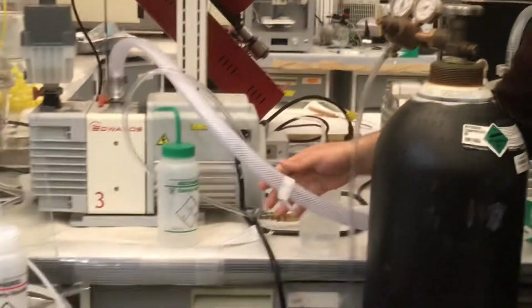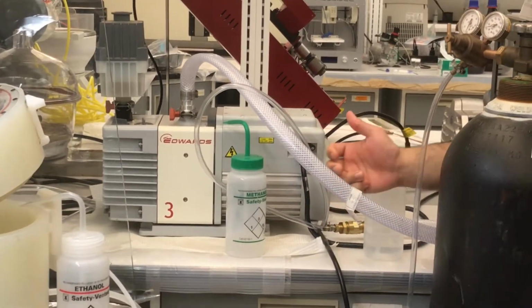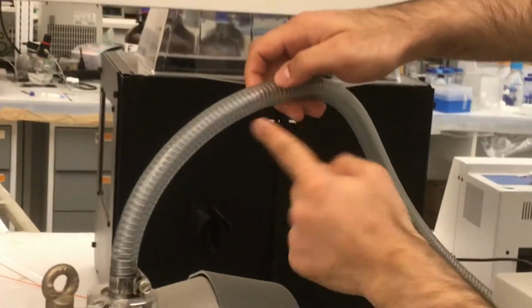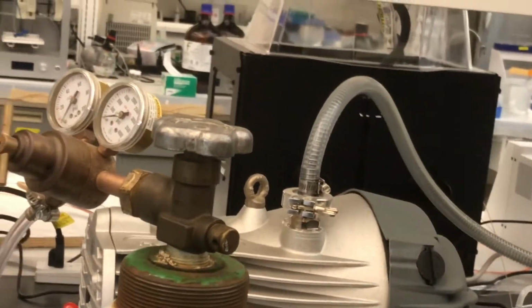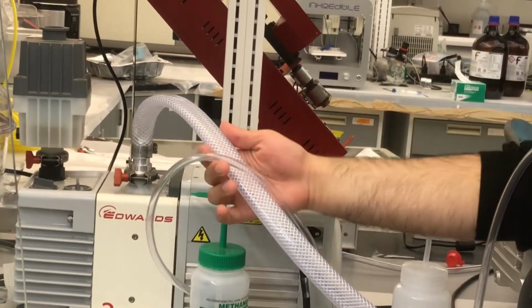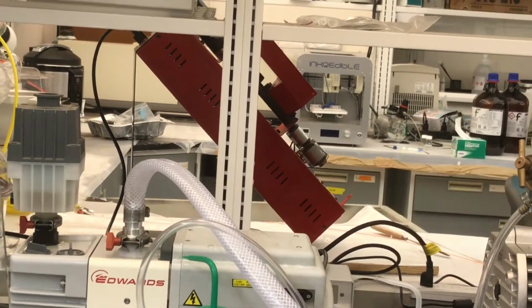Yeah, that's true. And this tube you can also find in Lowe's. I tried to find the better tube that I can use. Those tubes have some metal inside, and it prevents the jamming. But the problem is those tubes are only sold with this pump. Unfortunately, I called the company, I even searched Amazon, everywhere, but those tubes are not available in this size for this pump. That's the reason we couldn't find it.